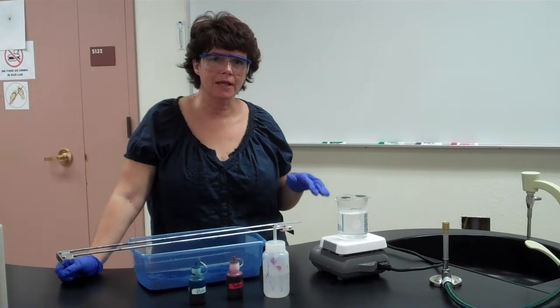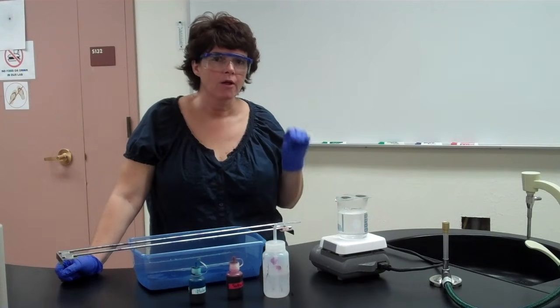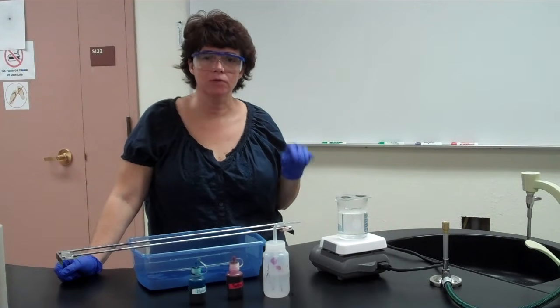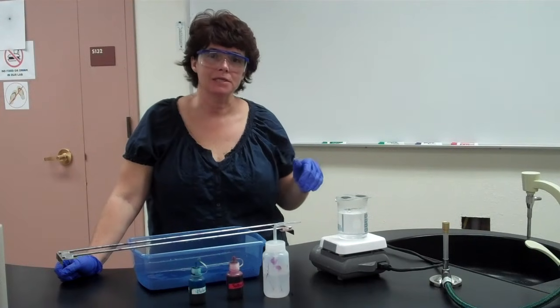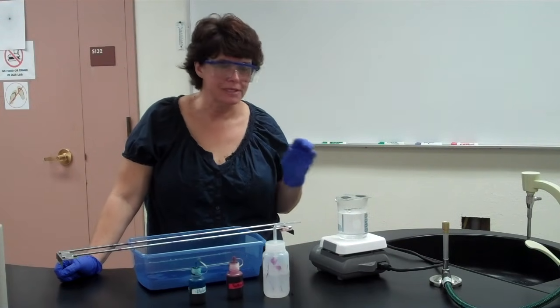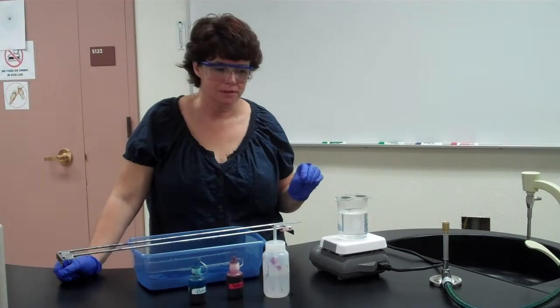The steam allows the stain to penetrate the endospore wall. Once it penetrates the wall, it can't come out. So then when you rinse it, it remains in the wall of just the endospore. The actual cell itself will lose the stain and be colorless, okay?